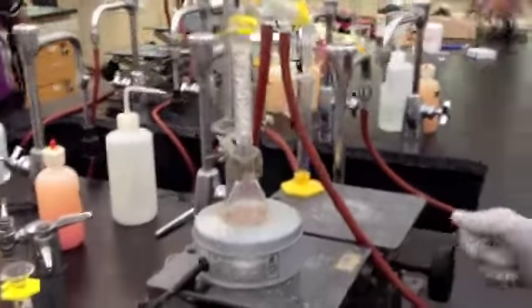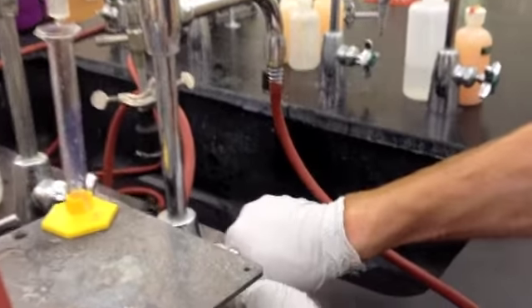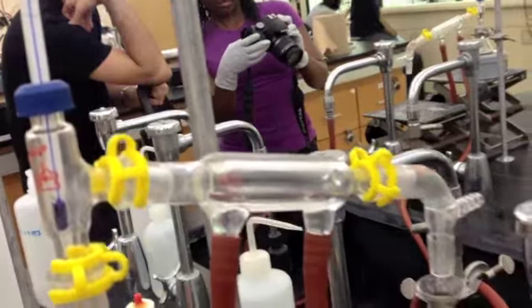Right now, we're just going to wait for this to boil. Make sure when you have your apparatus set up that while you're boiling, you run water through it. So very lightly at first, open up the water line and make sure water is flowing throughout.